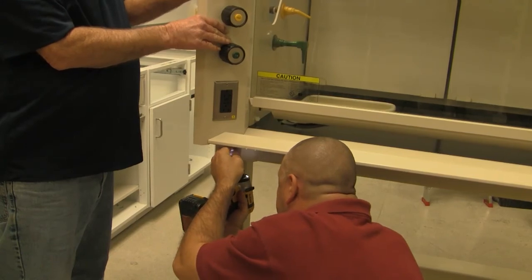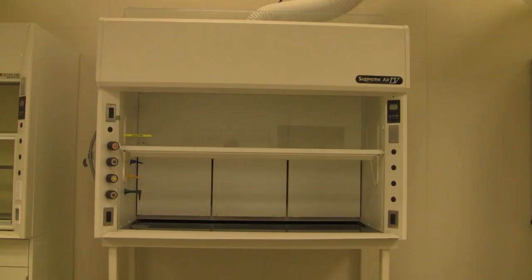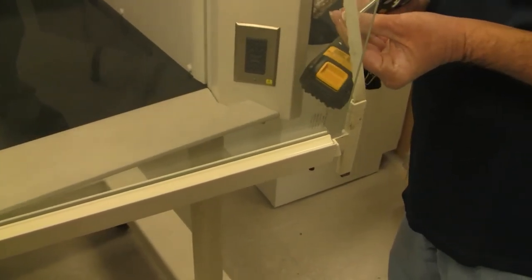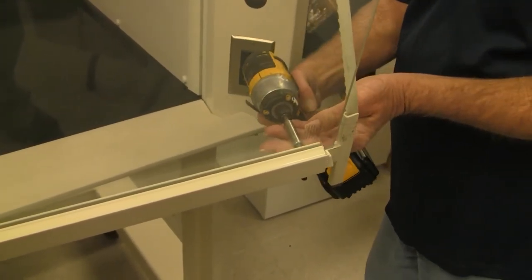Unclamp the belts on top of the hood. When finished, if the sash is not centered in the hood opening, you can adjust the lateral position of the sash using the belt attachment points.